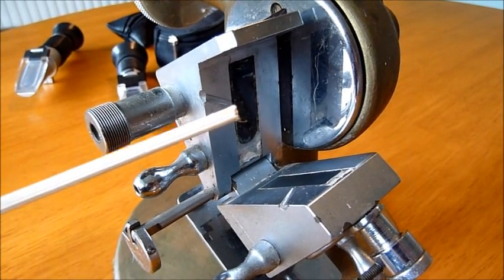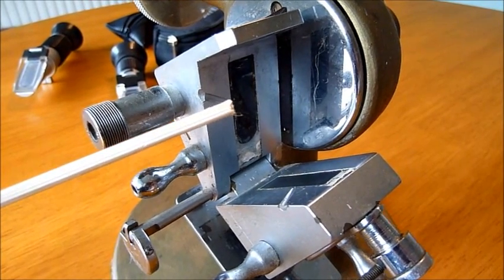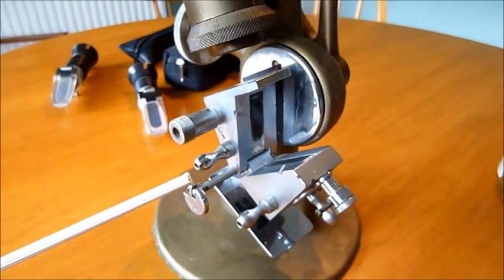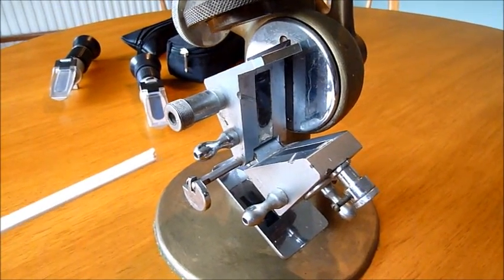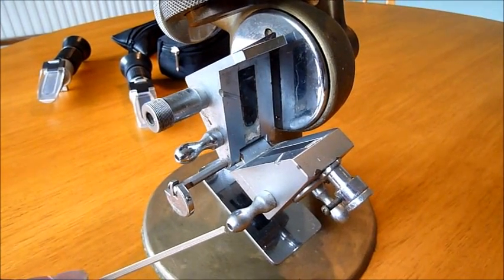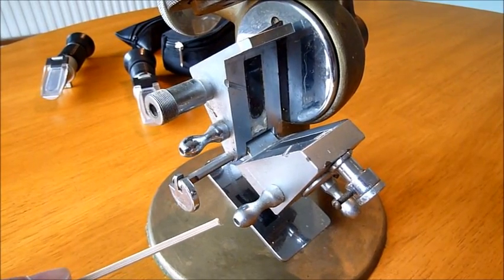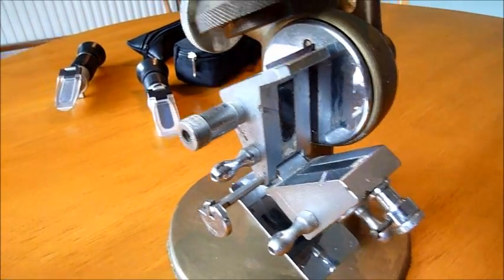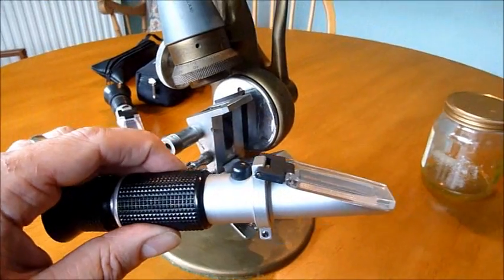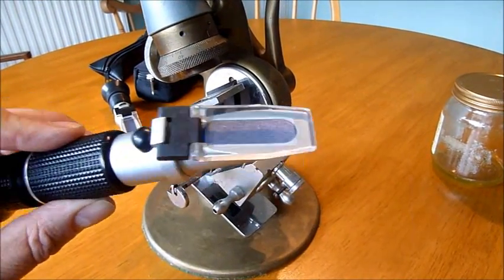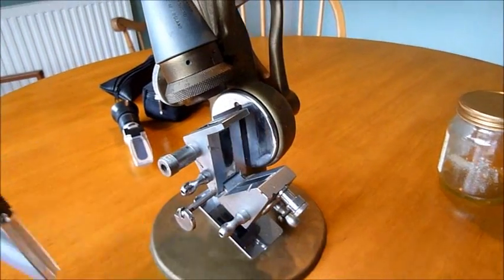The bend that the honey in this instance gives to the light is then captured against a reference point. To do this, light has to come through, and that light comes through in this quaint old thing via a mirror at the bottom which you move in exactly the same way that we would move one of our handheld refractometers like this towards the light so that we can actually push the light down through that prism and out through that eyepiece.